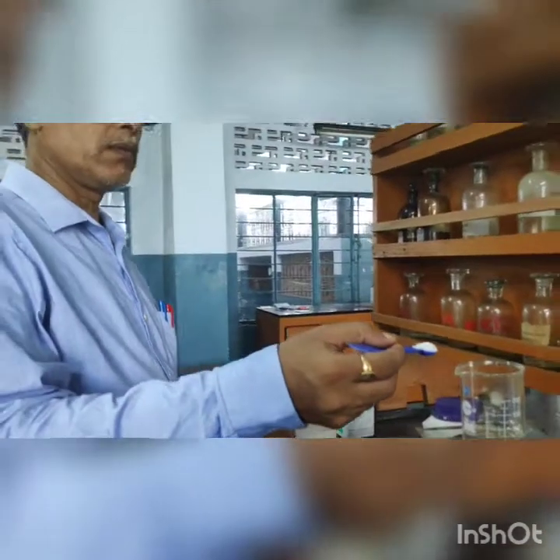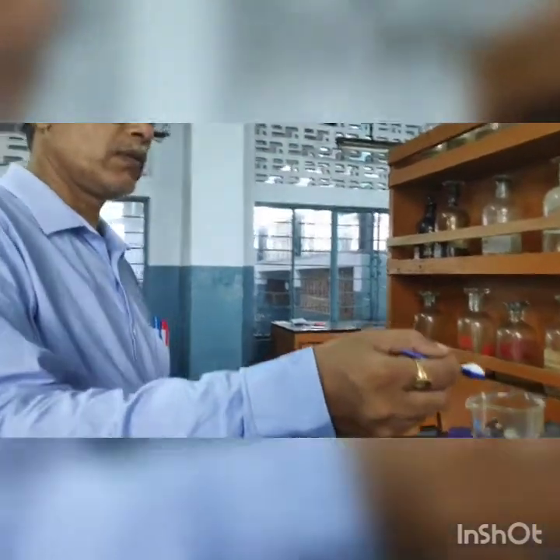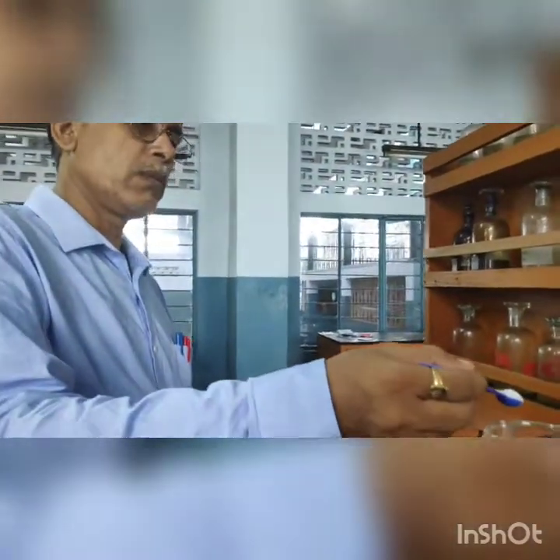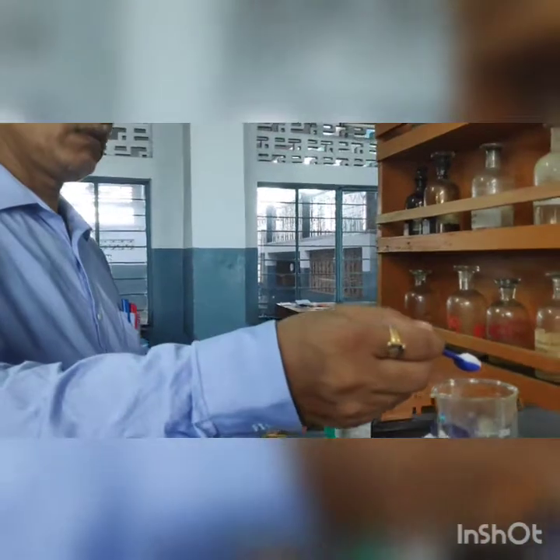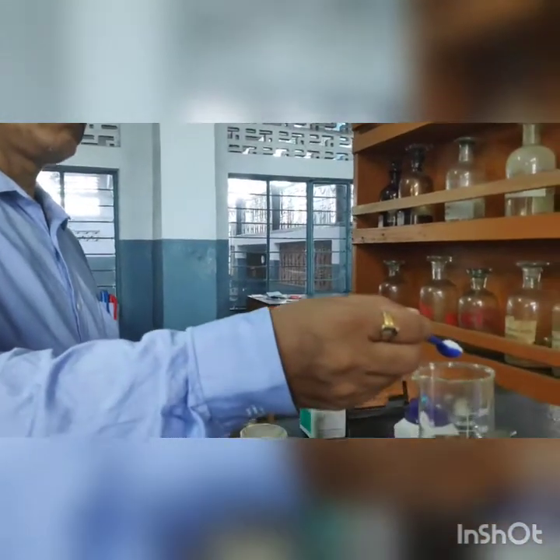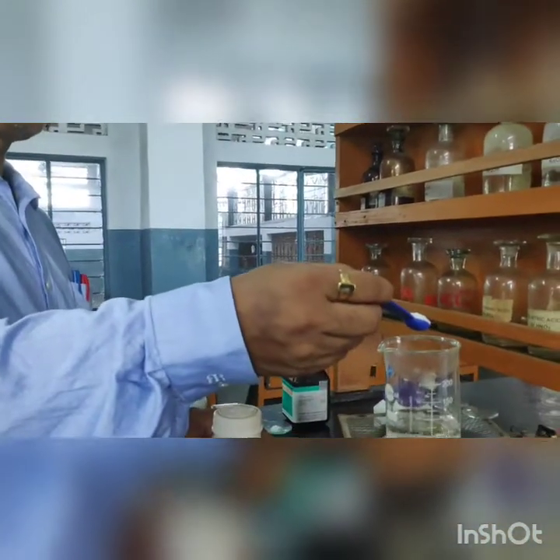Hey children, we are ready to start with the demonstration of preparing sodium carbonate extract.